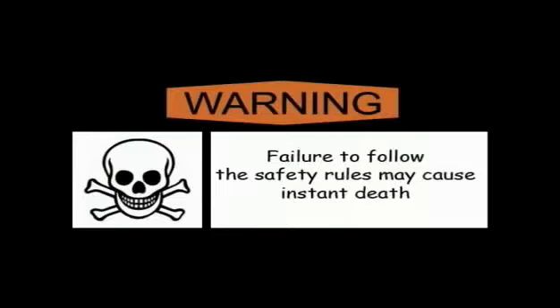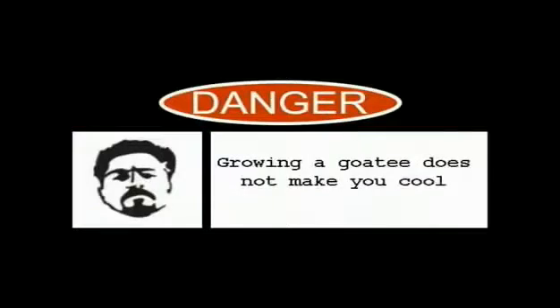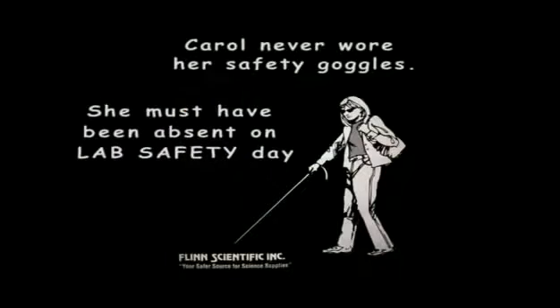Failure to follow the safety rules may cause instant death. Do not visit Tokyo during Godzilla season. Growing a goatee will not make you cool. Carol never wore her safety goggles. She must have been absent on lab safety day.